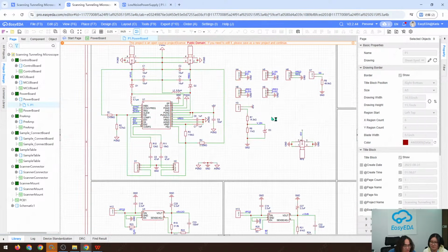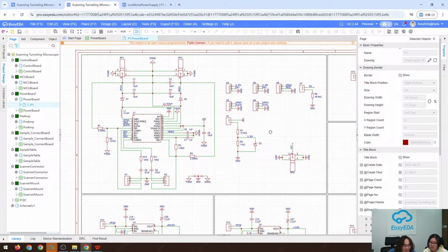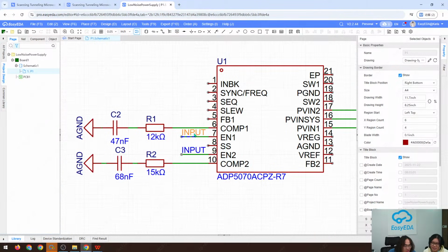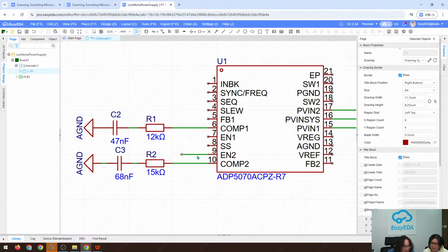So you can literally copy my design. It can work. Yeah, I verified it. It can work. So let's continue. We just leave it. It can be floated. So these three pins can be floated.